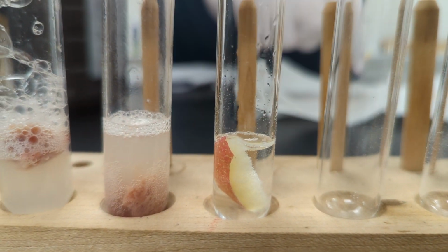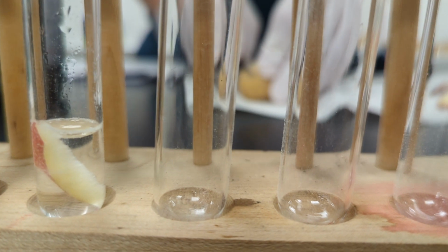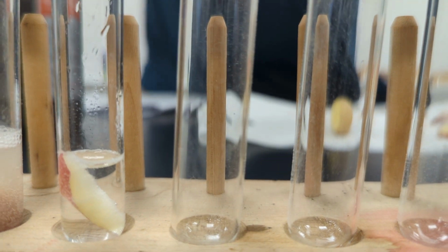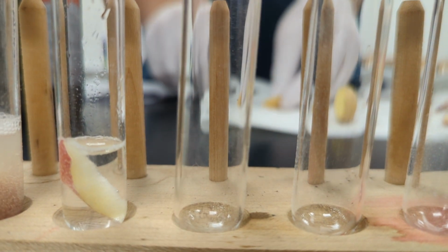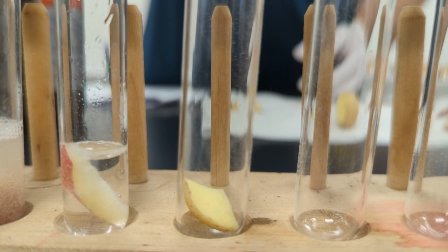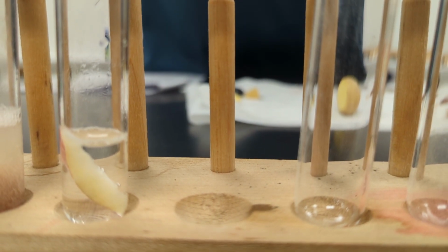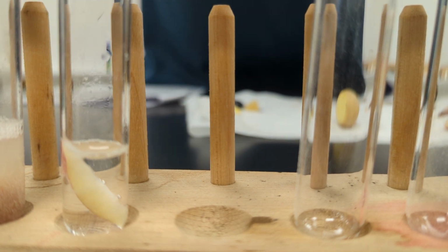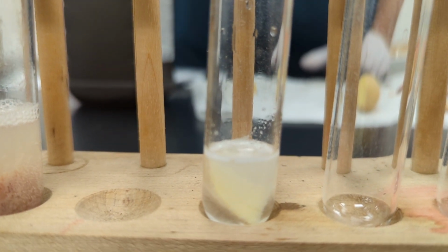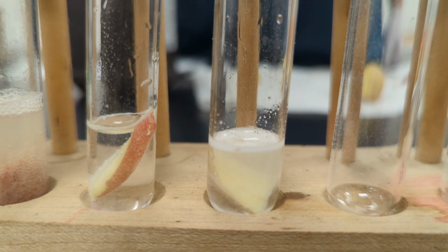All right. We'll repeat the same process with a potato. Are these locally grown? Obtained from Kroger. That ain't gonna fit. So potato is test tube 4. Yeah, we're in test tube 4, which is the potato. Need to see. Apple's still not doing something. That's the apple. The apple is number 3.